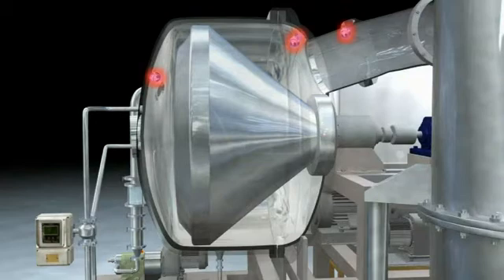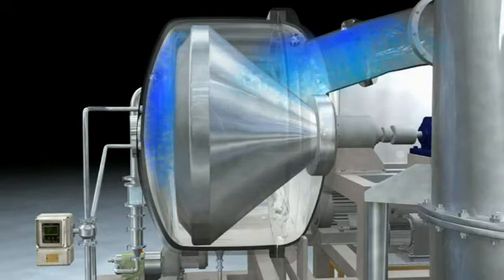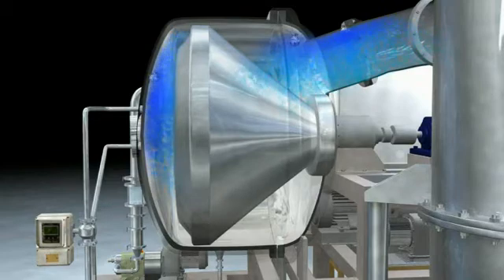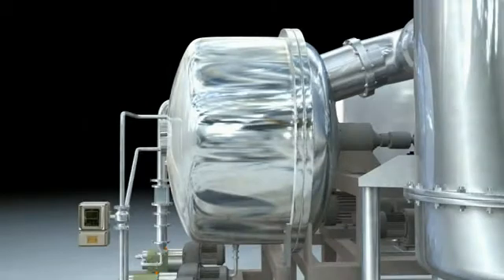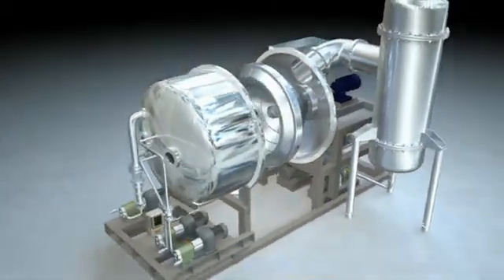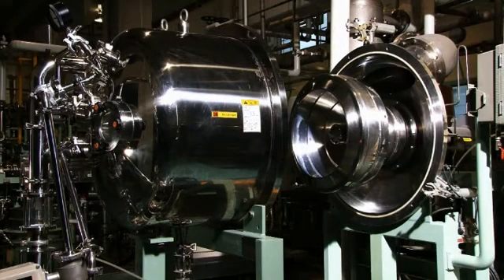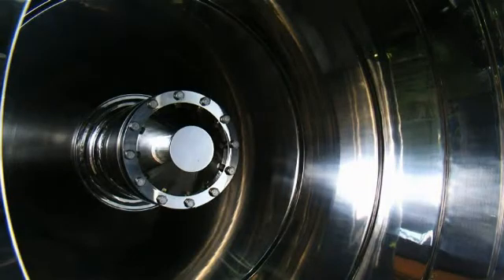Optional cleaning balls can also be mounted, enabling cleaning of parts such as the shell interior and rotor. After concentration, the Evapor's segmented design makes it easy to open the unit in front and back and confirm that the evaporation surface, shell interior, and other surfaces have been thoroughly cleaned.